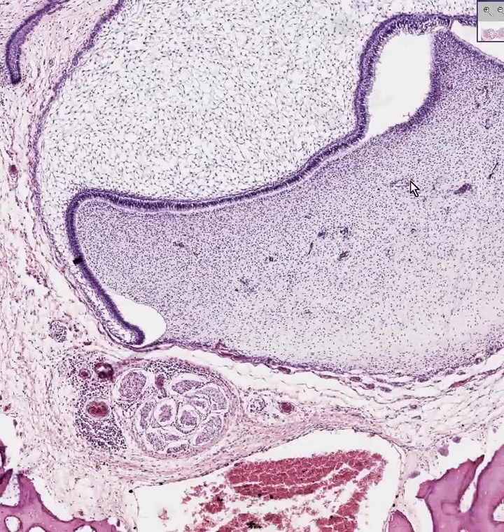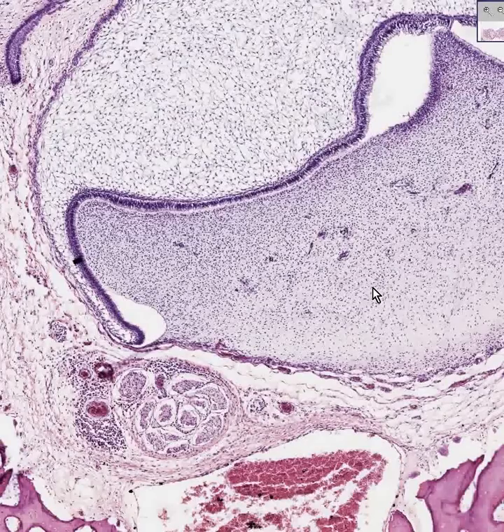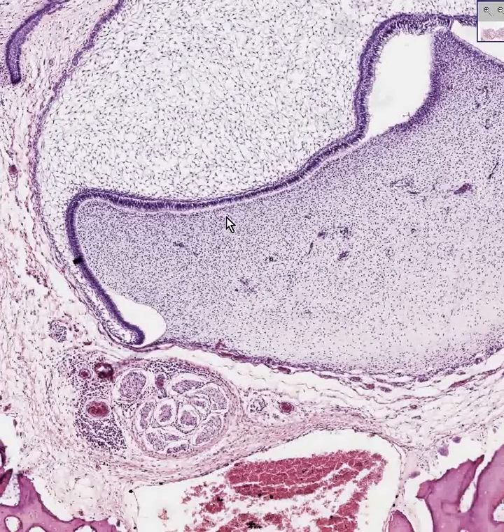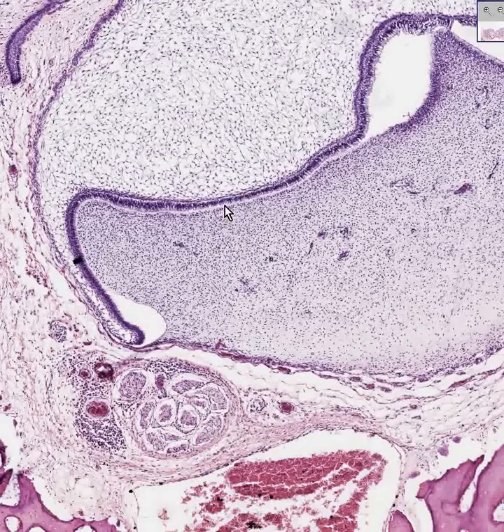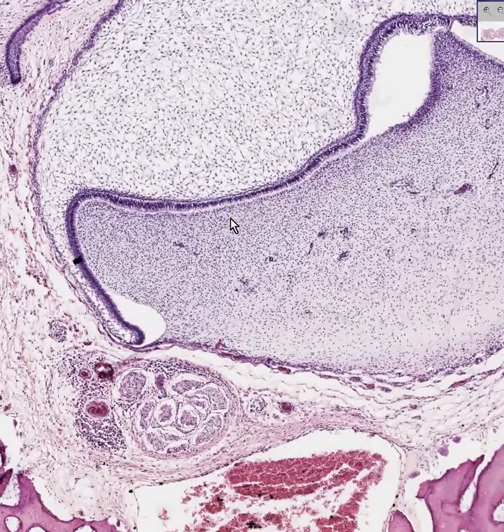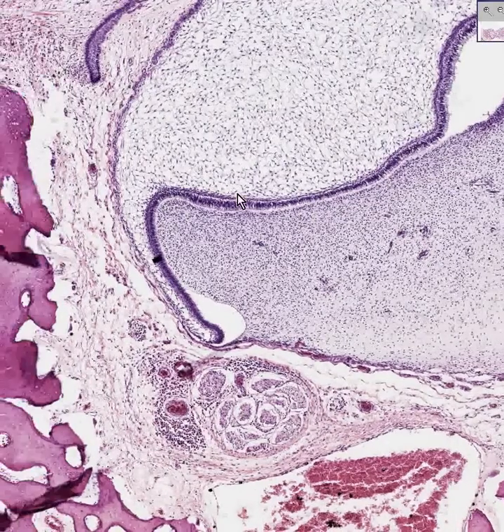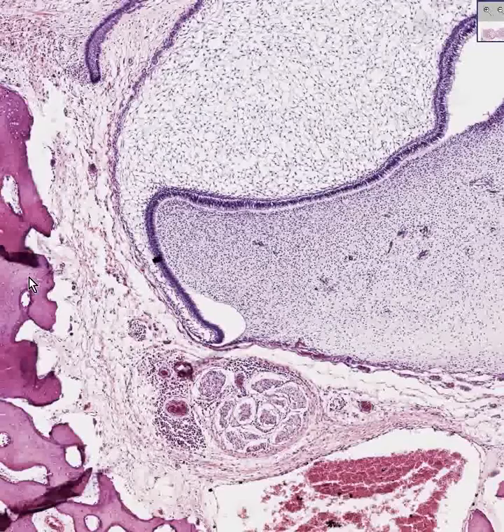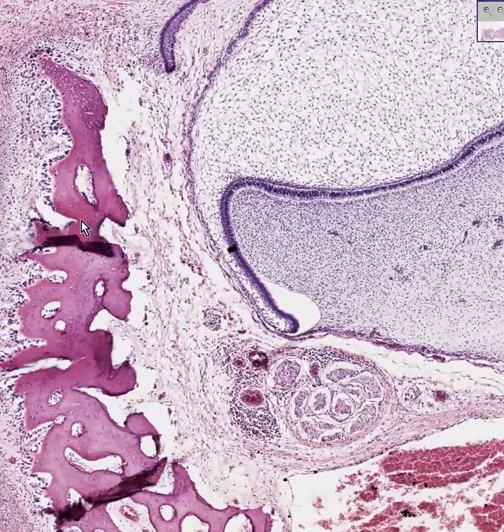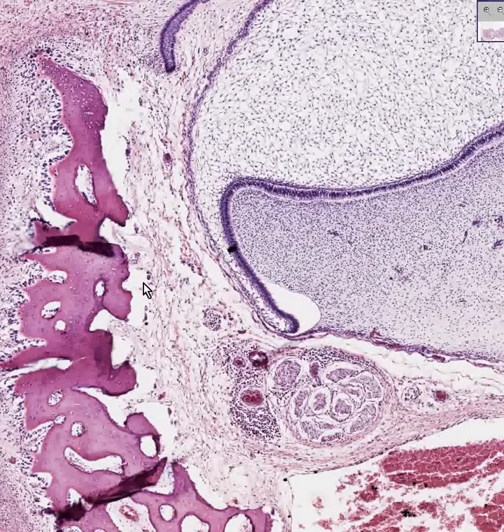These are now more fully developed and differentiated to become a fully developed line of ameloblasts. This is still primitive connective tissue of the tooth — the pulp cavity. And of course you don't see any true enamel or dentin developed yet, but you do see a nice rim of ameloblasts. You also see a lot of more mature bone in the mandible.